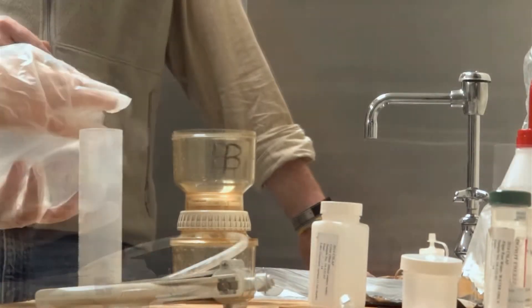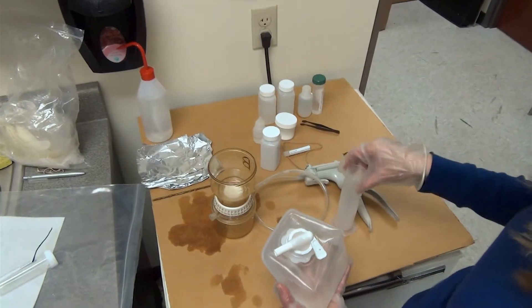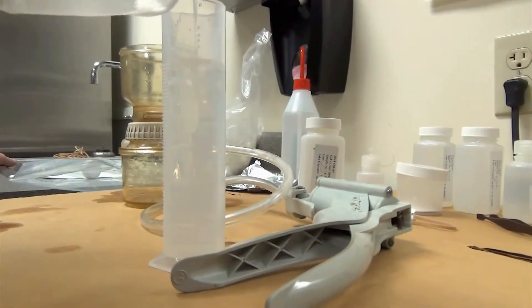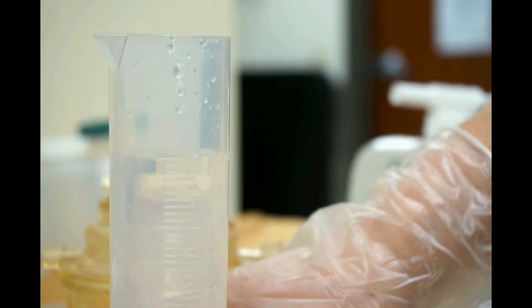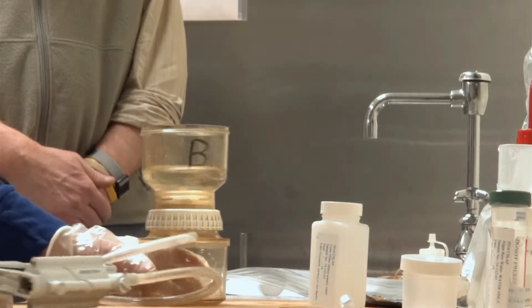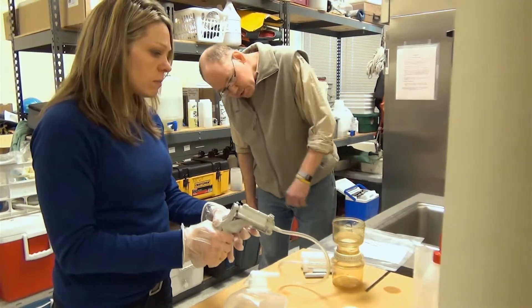For that procedure, take your collapsible container and invert it again since it's been a couple of minutes since the last step. Then take your graduated cylinder, rinse it with distilled water, and fill it with 100 milliliters of water. Check that the water level is exactly at the 100 milliliter mark, then pour it directly into the funnel. The water won't move on its own — it must be drawn through the filter using the hand pump. Depress the pump four or five times until you see the water start to draw through.